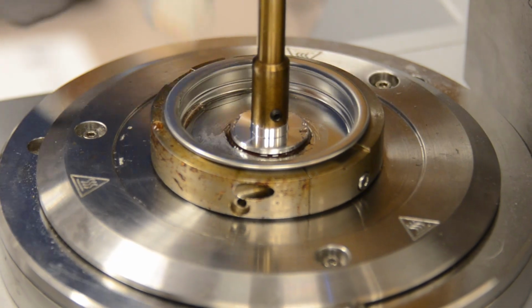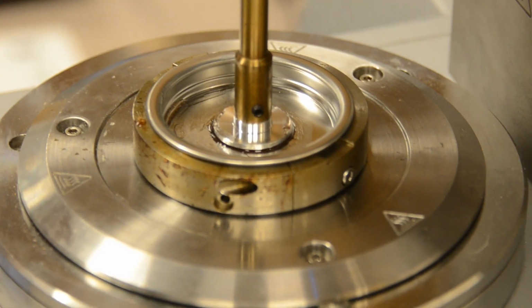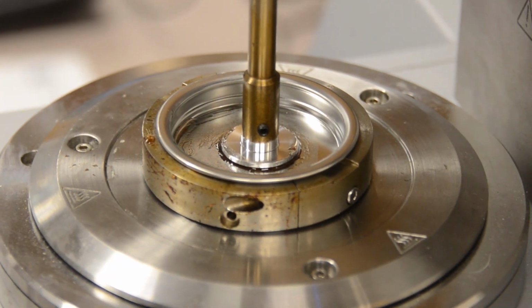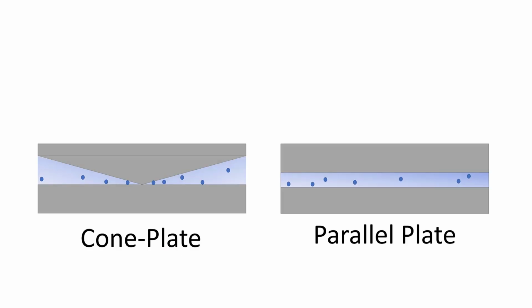Different measurement systems can require different volumes of sample. Parallel plate geometry can produce results with a very small sample volume. Other geometries may require larger volumes. Samples which contain particles may not test well with cone plate geometry, since the particles may come in contact with the testing surfaces and can upset the measurement.